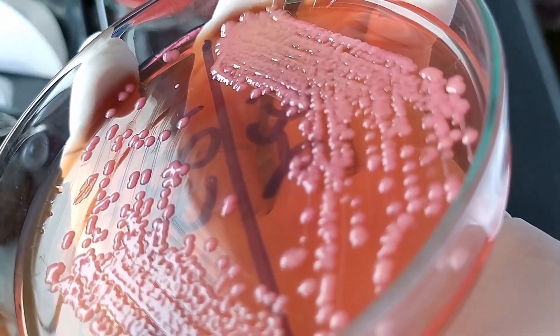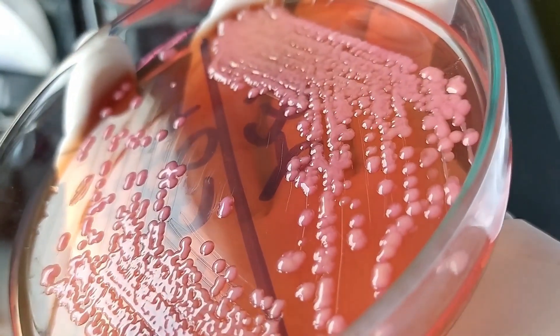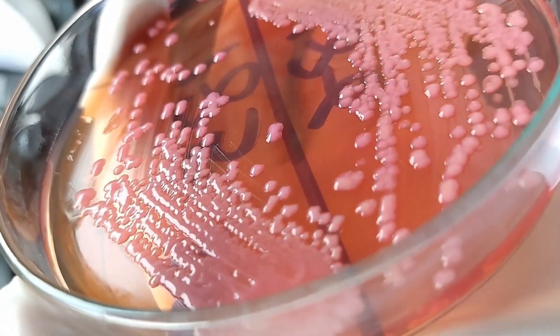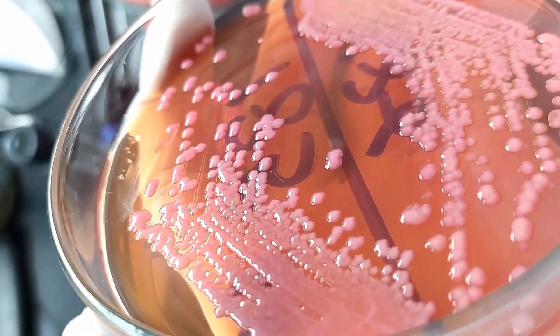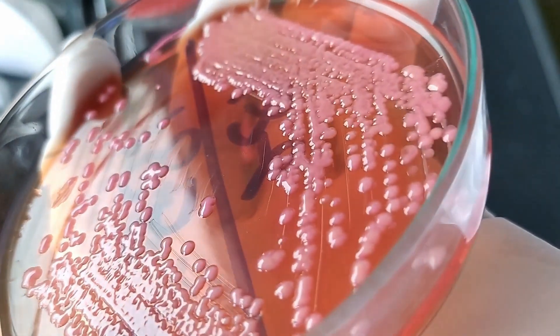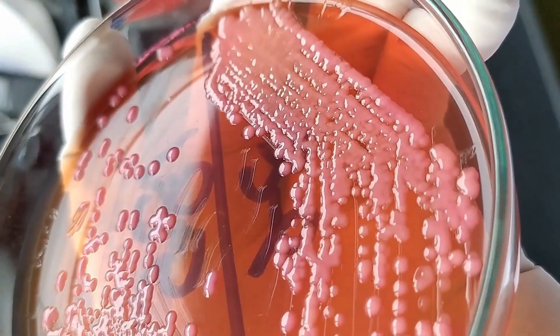On MacConkey agar, Klebsiella pneumoniae colonies are circular, mucoid, and convex, with a diameter of 2 to 3 millimetres.